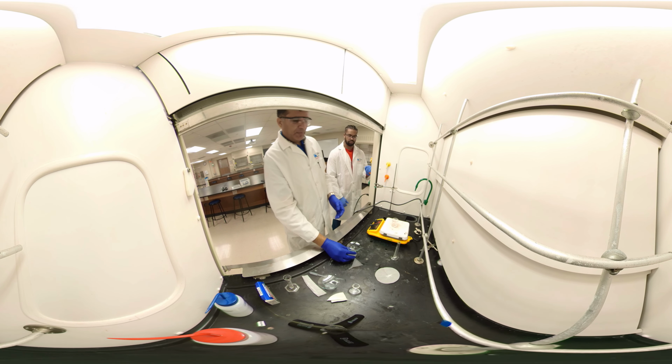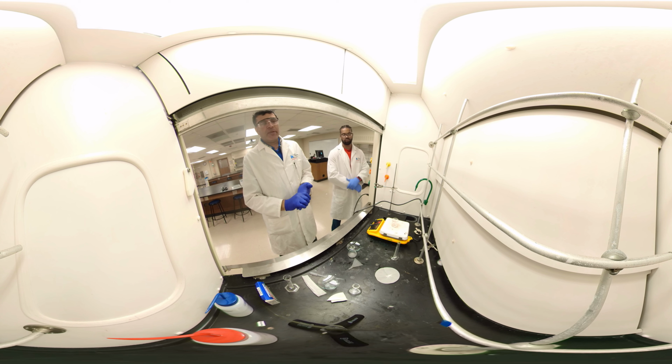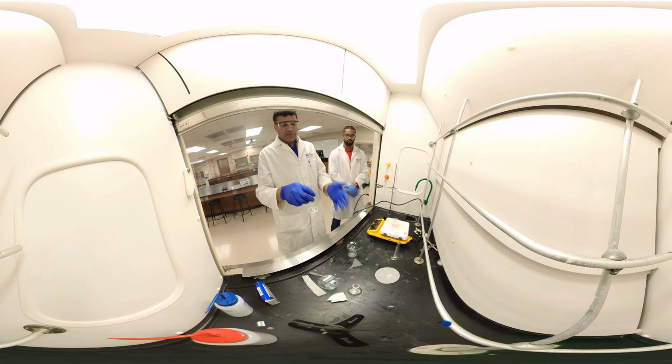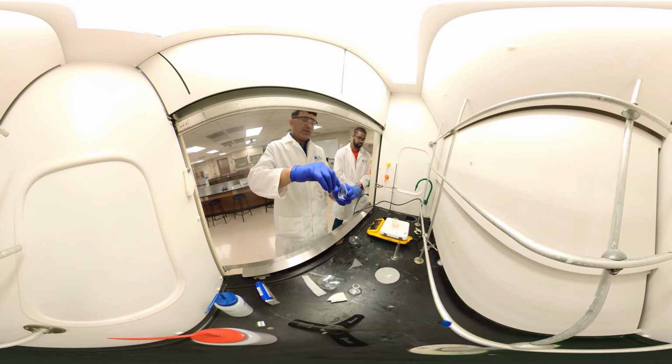If you look at the chemistry, caffeine does not react with the base, but aspirin has some acidic group that reacts with the base, like we have sodium hydroxide here. Once we add it, it converts that aspirin to the salt. Salt is soluble in water, and caffeine will be soluble in dichloromethane. So it will give you two layers, and we can separate using the separatory funnel. Let me put it here and see what happens.